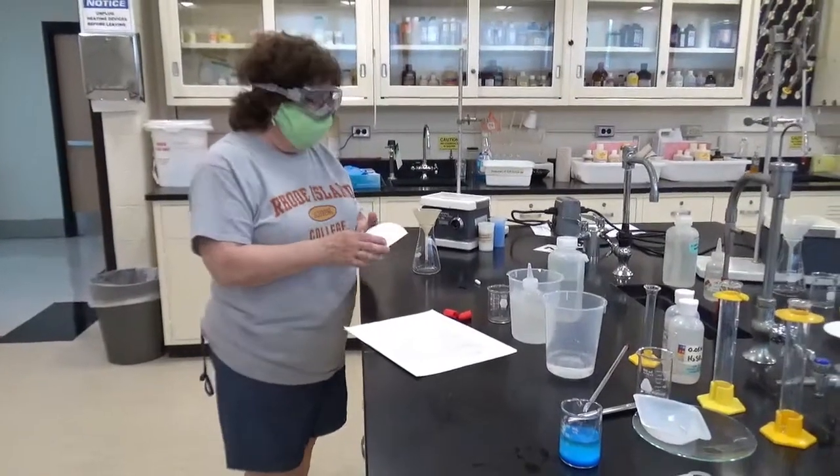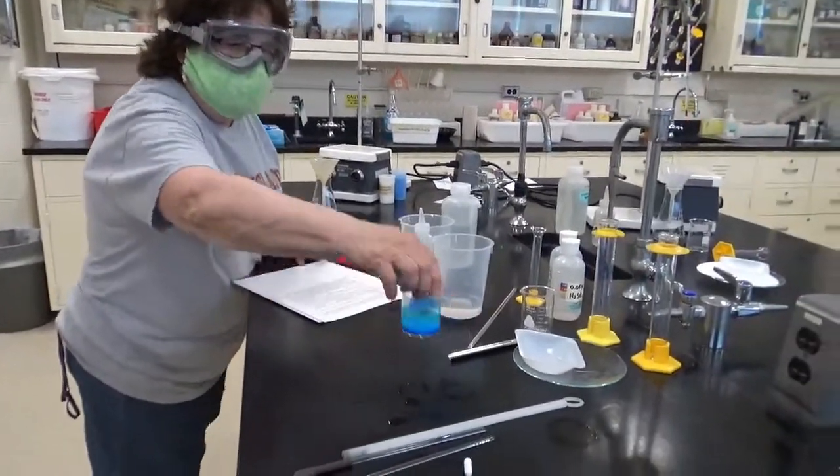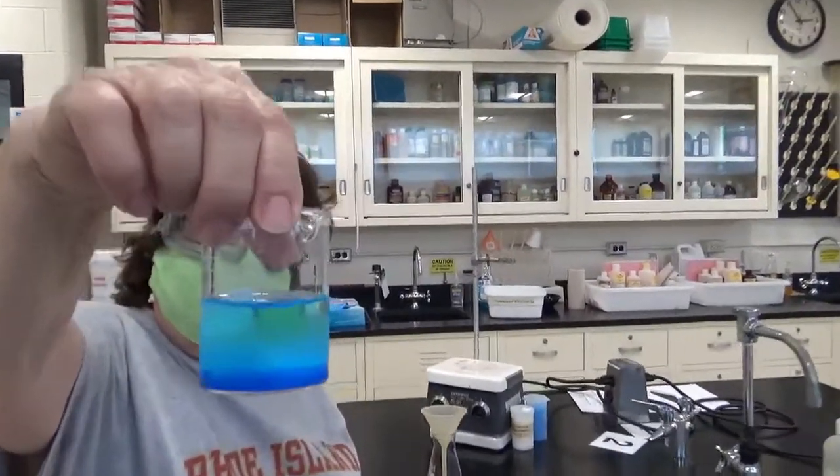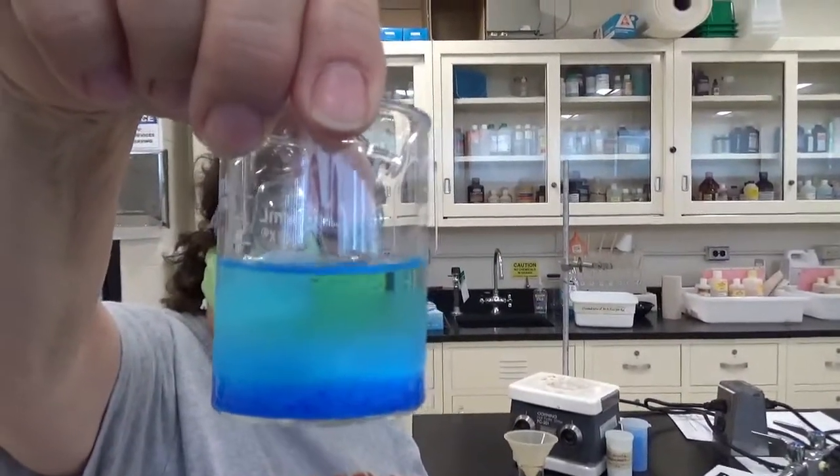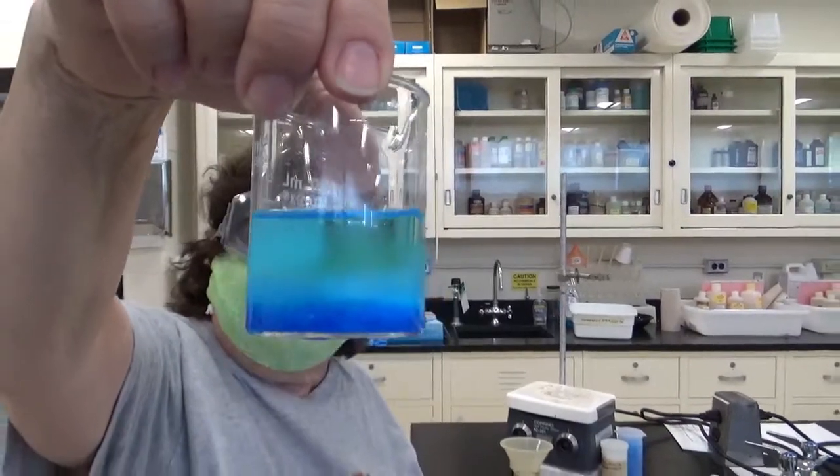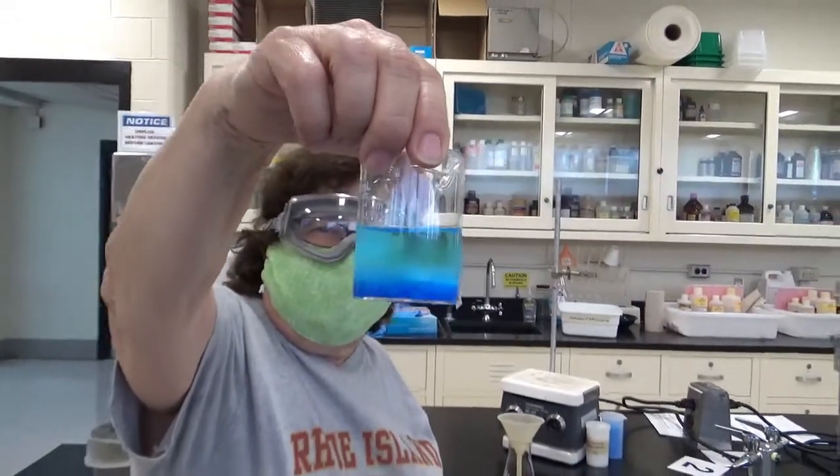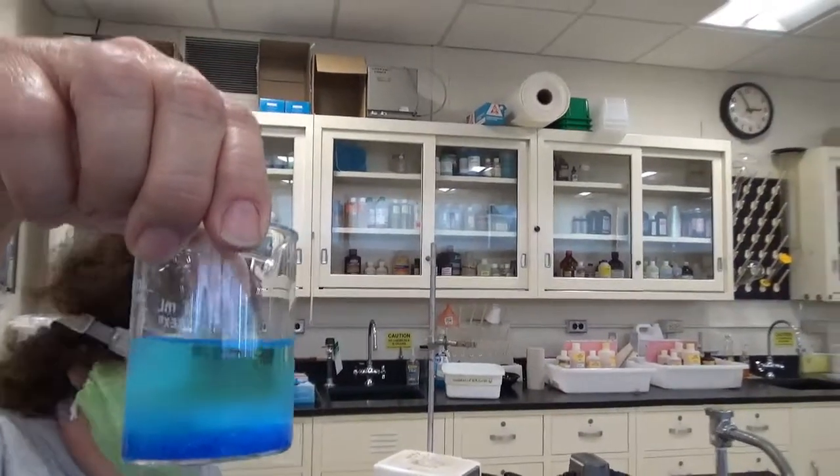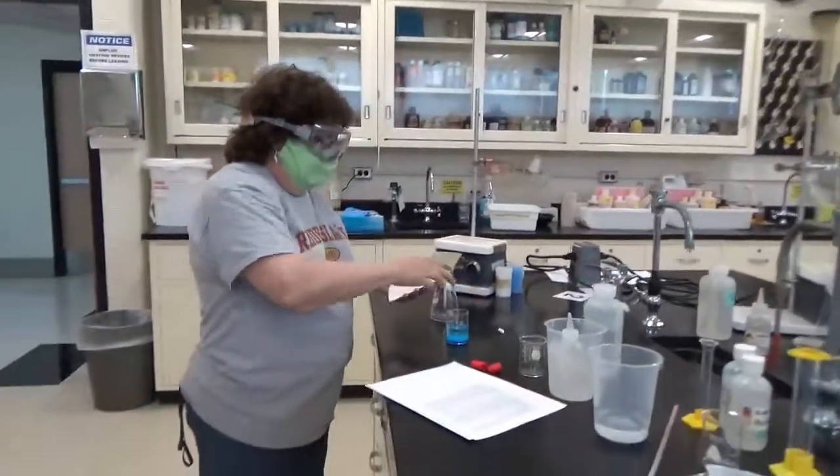So what we're going to do is we're going to be filtering our mixture. You'll notice that it has some dark crystals at the bottom and lighter at the top, and it's not quite transparent. It's transparent, but it's still got a color imparted to it.